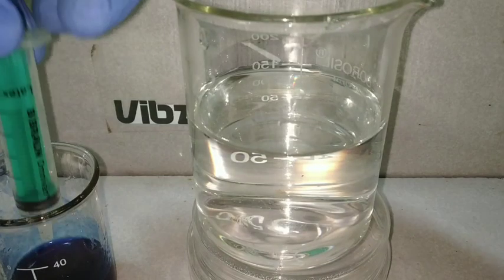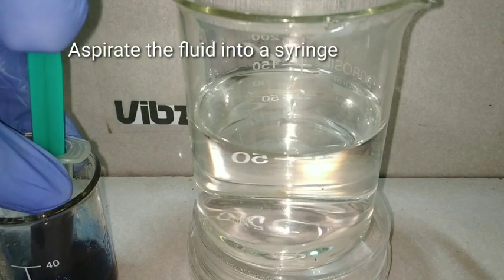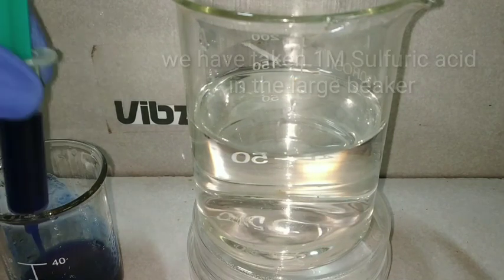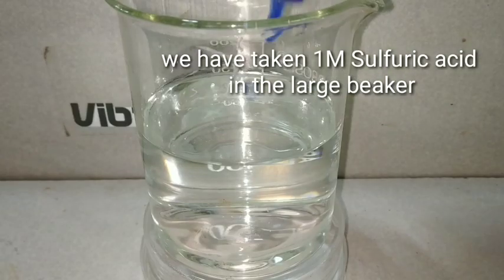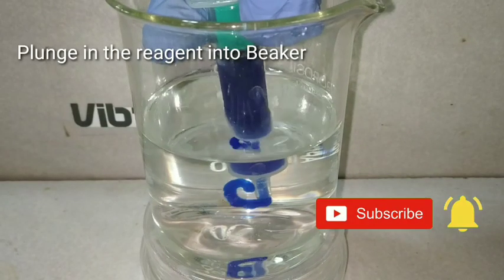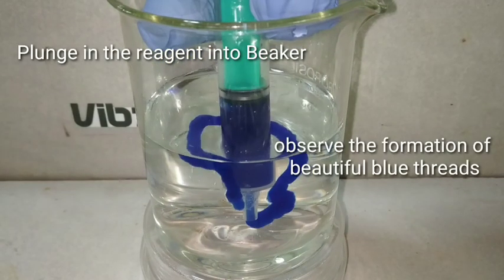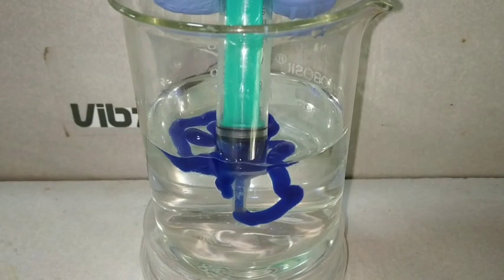We have now taken approximately 200 milliliters of 1 molar sulfuric acid. We aspirate the fluid which we made into the syringe and we will be now pouring it into the sulfuric acid. You can see that as soon as I release the fluid into the sulfuric acid, there is formation of beautiful blue colored threads. These are the threads of Rayon.